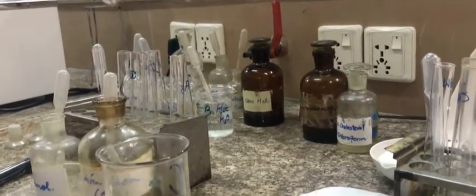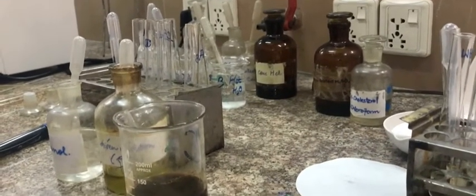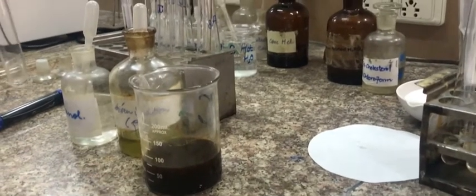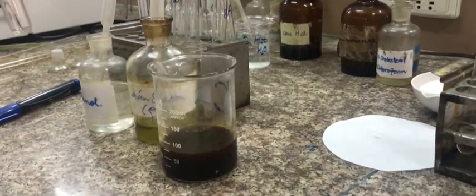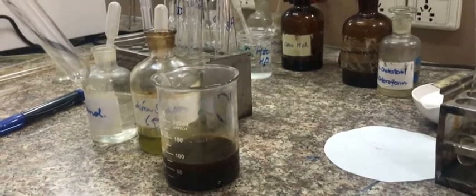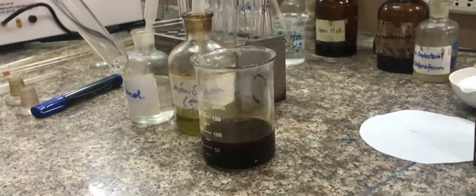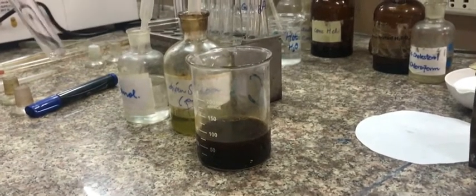Saponification. It is used to detect the effect of various salts and acidity on the solubility of soaps. Reagents used are ethanol, saturated solution of sodium hydroxide in alcohol, saturated solution of sodium chloride in water, saturated solution of calcium chloride in water, saturated solution of magnesium chloride in water, and concentrated HCl.